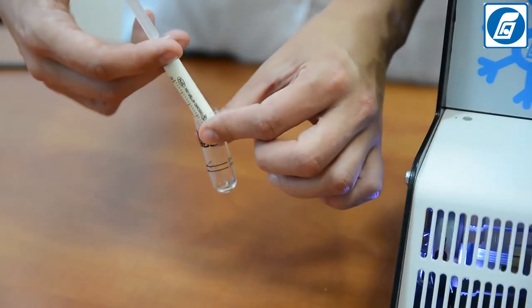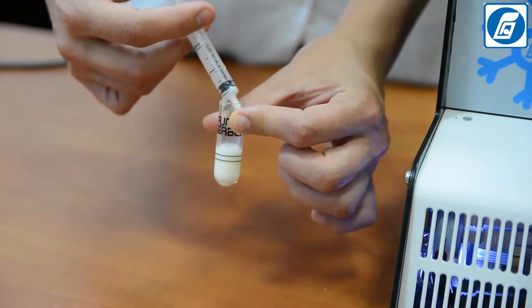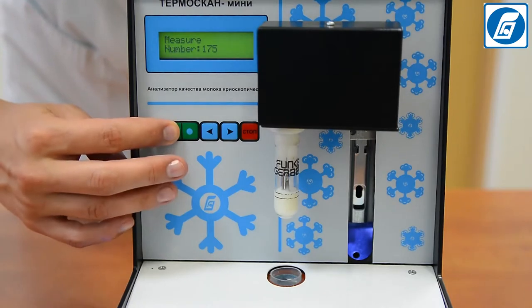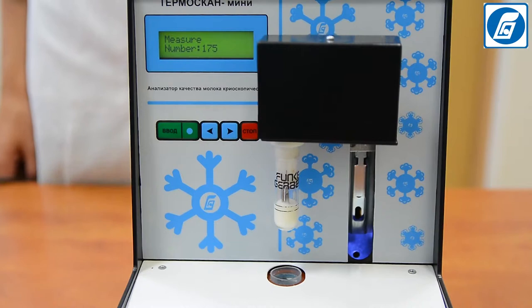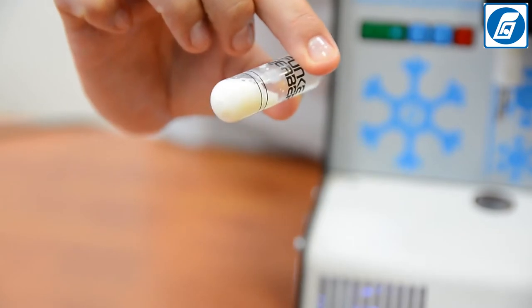Repeat the measurement with another portion of milk. If the difference in parallel measurements is more than 0.004, the results are rejected and two more consecutive measurements are carried out. Attention: we do not recommend reusing the same portion of milk, as freezing causes protein denaturation, which can yield a lower result.